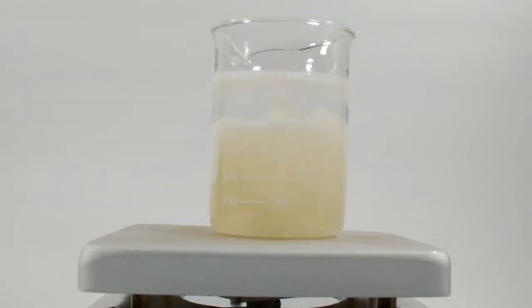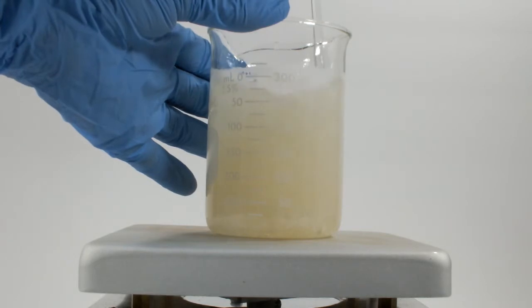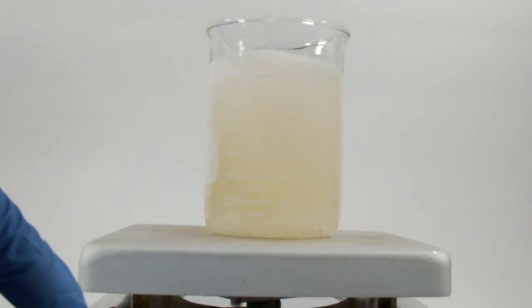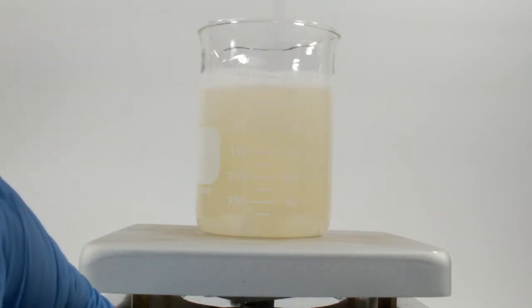At this point, I went back to the balance to add the rest of the water. Remember that there is a stir bar still stuck in this mess. I compensated for its mass by taring the balance with the beaker and the stir bar together. Once I added the water, I stirred it a bit with a glass stirring rod. And then the stirrer was able to do a little bit more, so I'm glad I left it in. I thought about taking it out before adding the TSP, but this way worked.